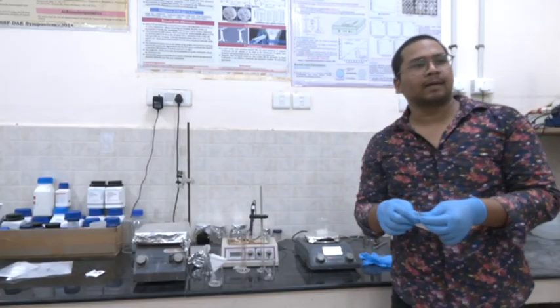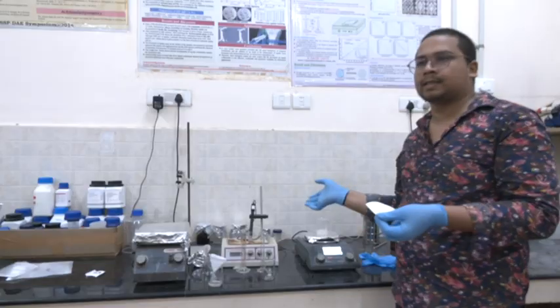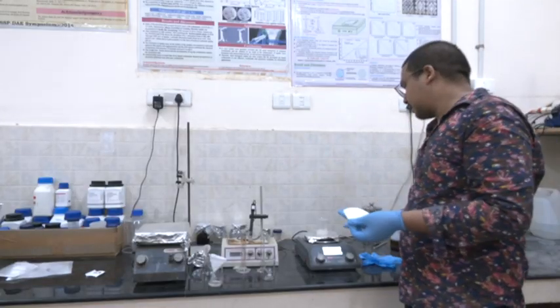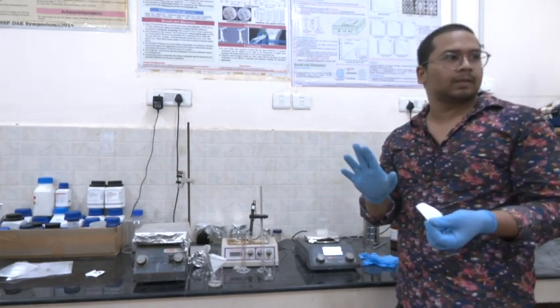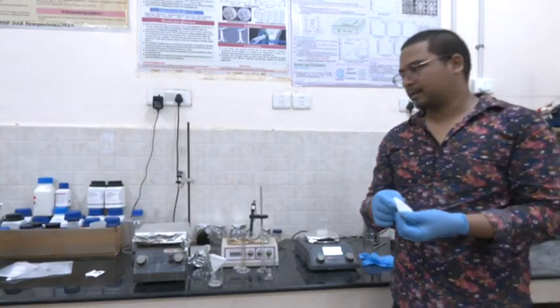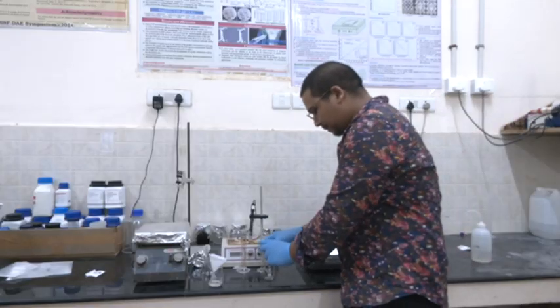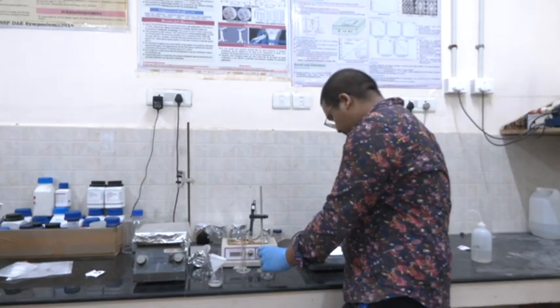While we are filtering, if any unreacted impurity is there, we'll take it out. We'll take only the dissolved silica solution, Na2SiO3, sodium silicate solution.